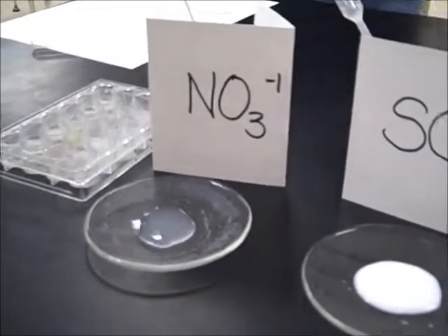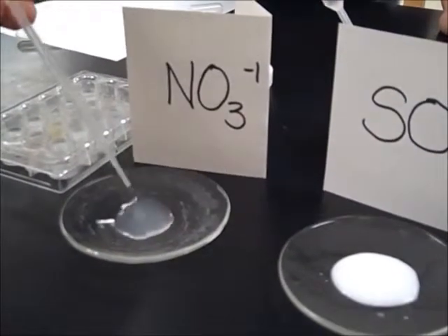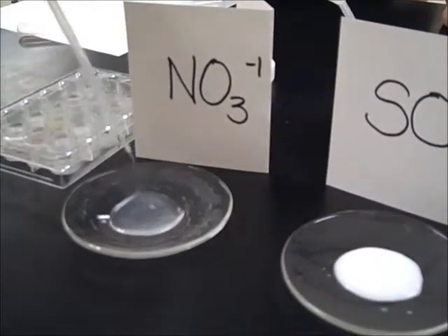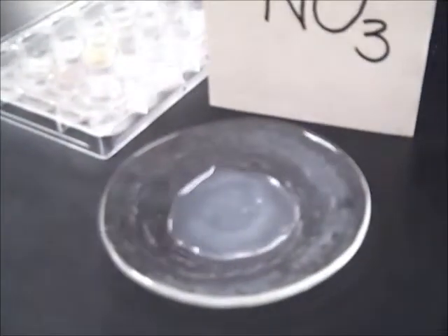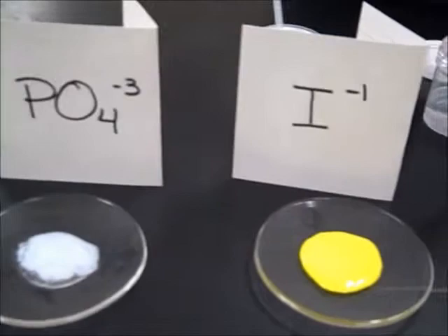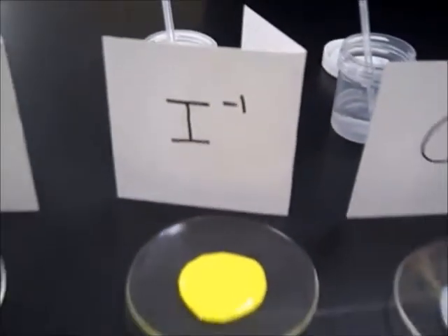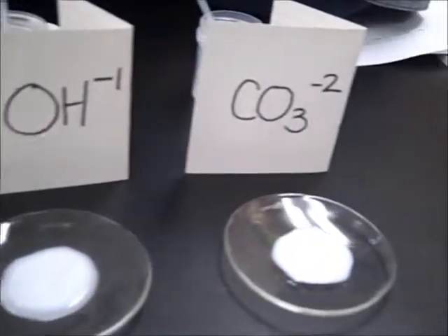And the last one there is going to be lead and nitrate. It's a letdown. That's right. No reaction. Of course, I would get the one with no reaction. Of course you would. I planned it. So the other ones, though, had some really nice reactions. She likes that one in the yellow, I think.